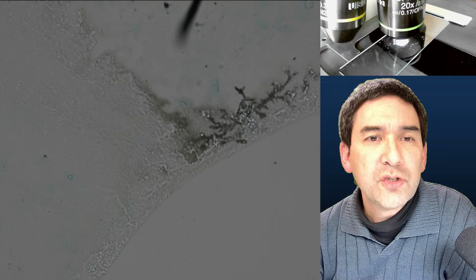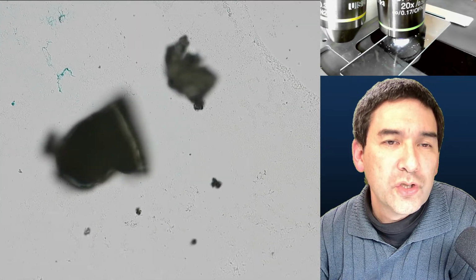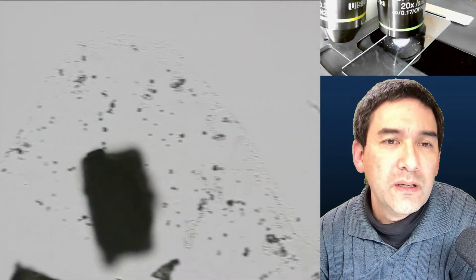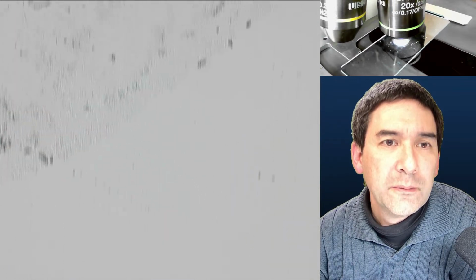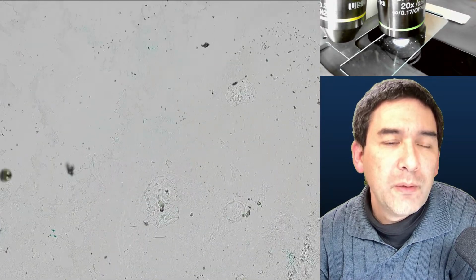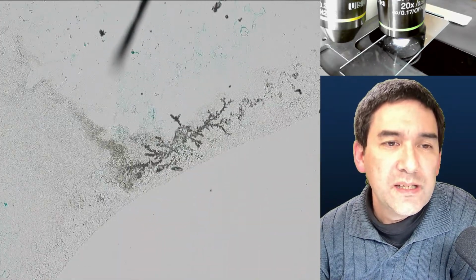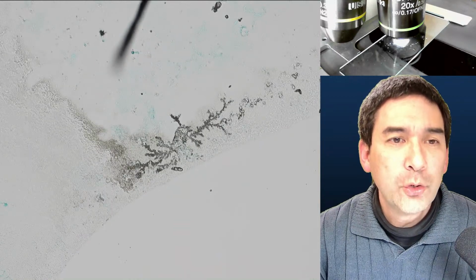but I was able to find, at high magnification in some places, indeed some crystals here, those tiny things that you see over here. I think I just need to optimize this a little bit, but you can see it looks like those tiny branched structures. Over here, for example, these are the chunks of crystals, but only in certain places was I able to see those fine branched structures of crystals. It takes a little bit of patience to find. So this is one that I have to try to optimize a little bit.